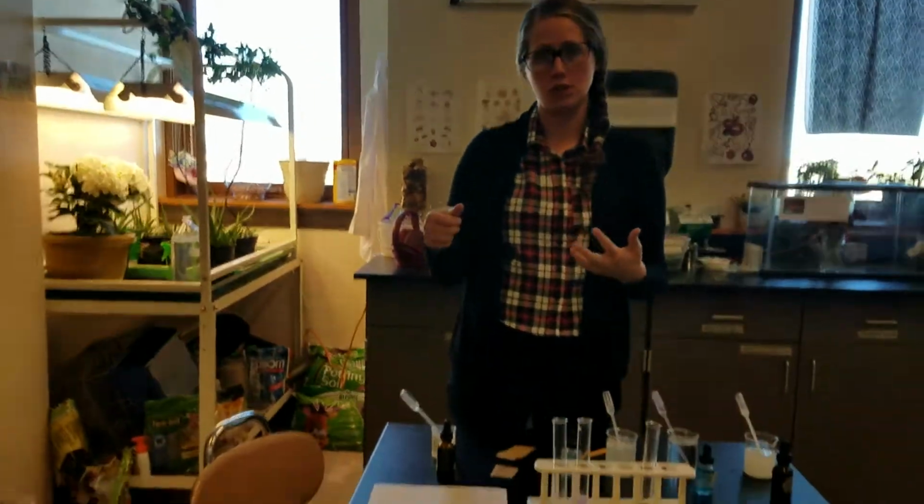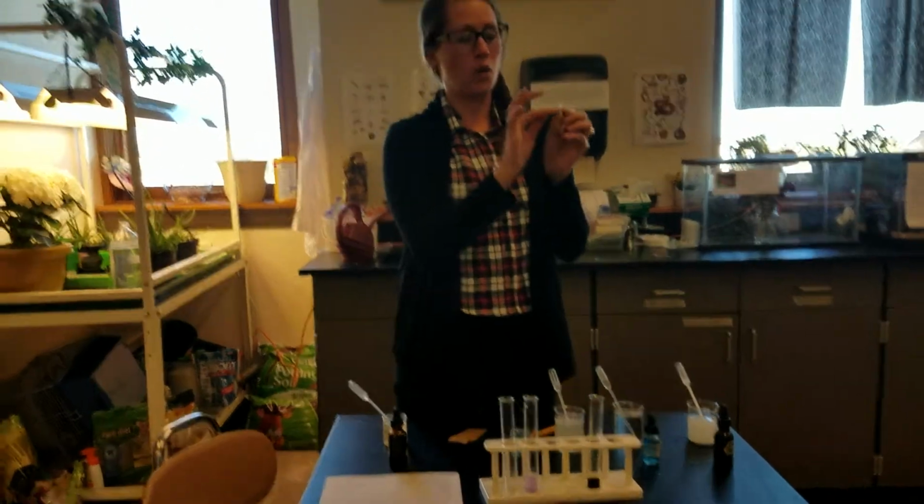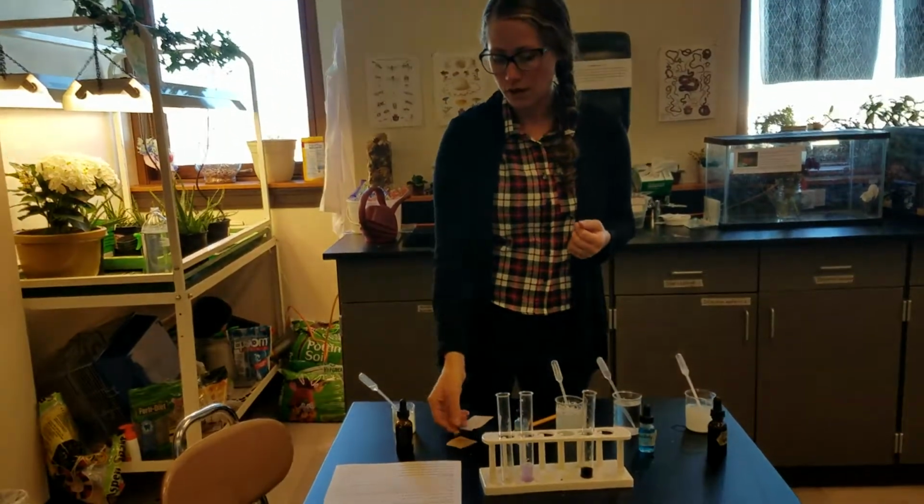So you'll have to put those on there and wait a while for it to dry, and you can just write a little label on there, like I would write corn oil on this, and then set it aside and wait. And then you can come back to those and find out.